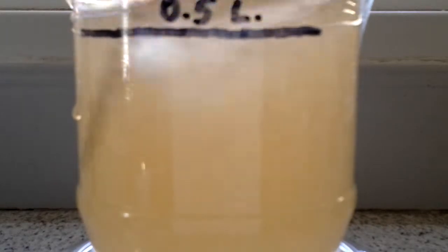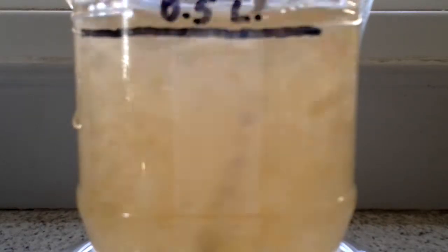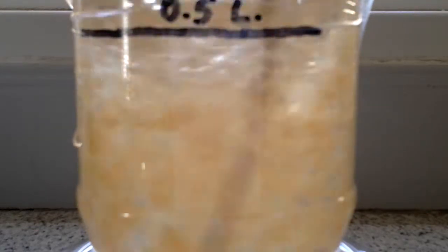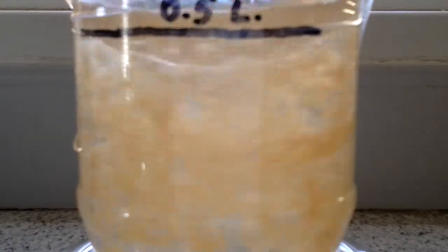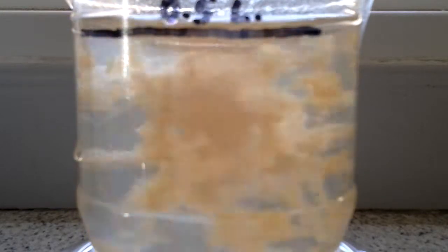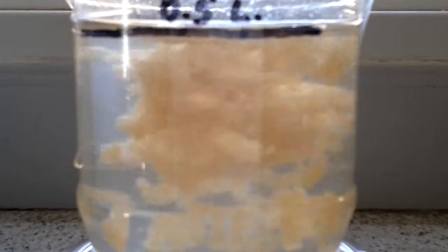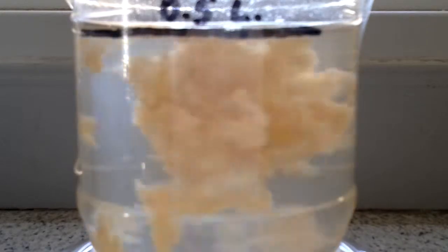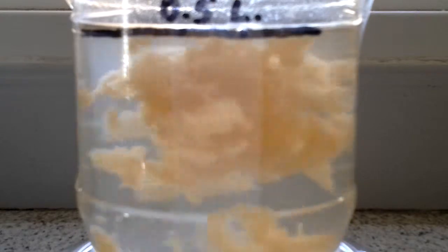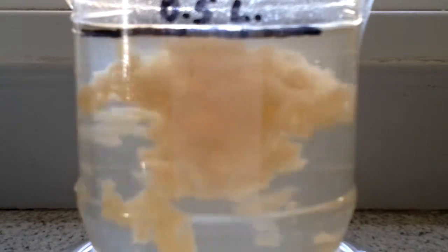And then we will add the 3% of B. We can see how fast the flocks are created. These flocks can be separated easily with simple filtration.